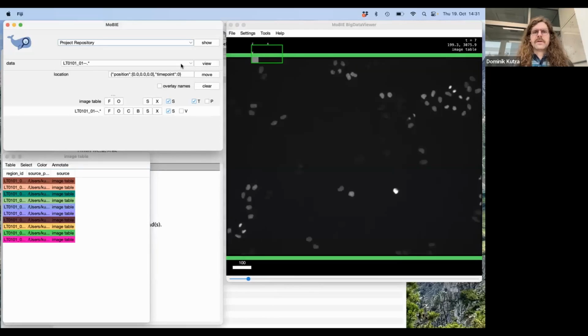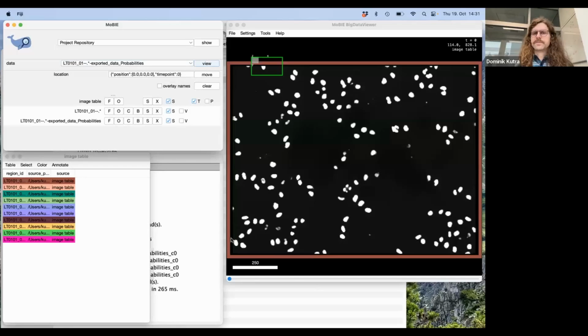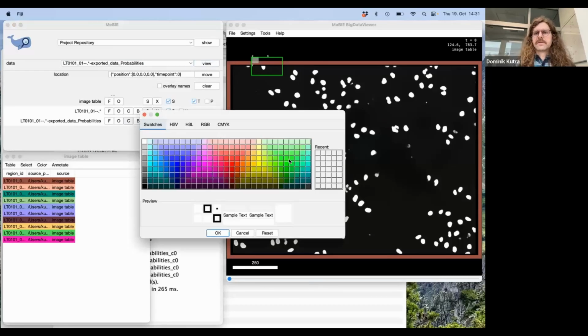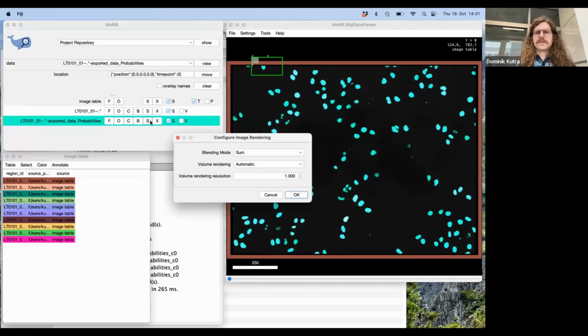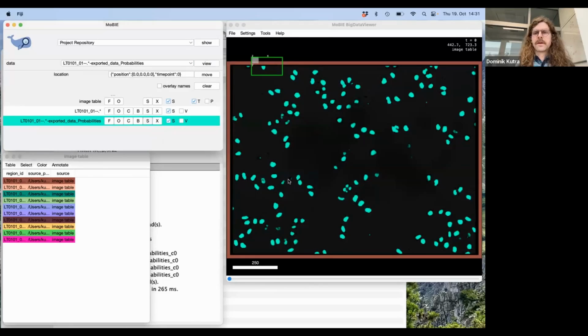Yeah, to now add our additional probabilities, we go here to this data field, drop down and select these probabilities and click on view, and then they will be shown. What I would recommend now is to change the color of those to something that you like to see, and also change the blending mode to alpha. This means it's overlaid on top of the original image.